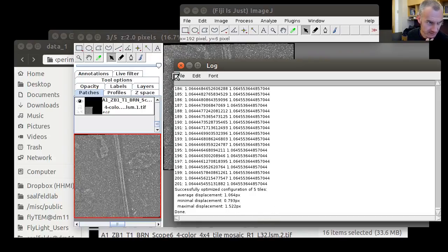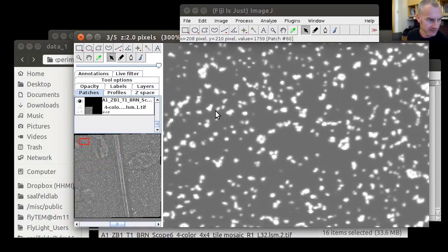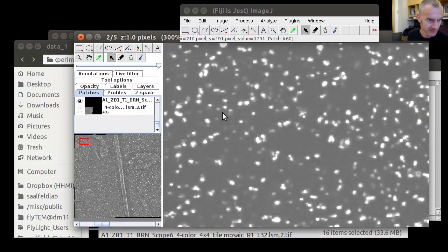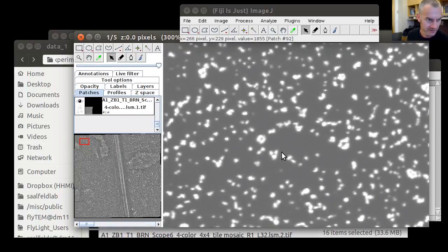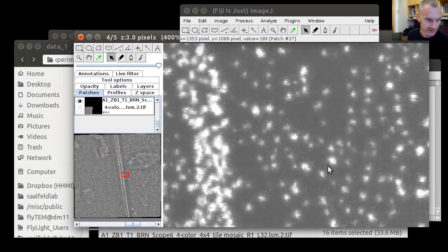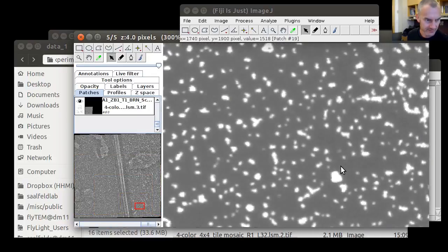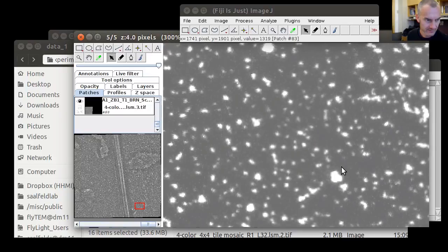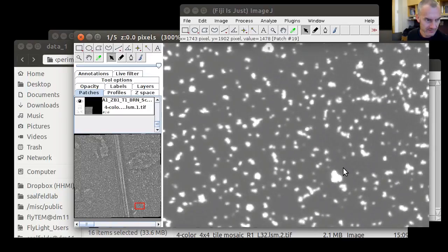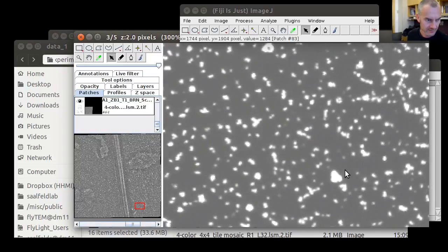Oh, so to me it seems that in the previous run we had included a couple of features that were actually not in the pool of good matches, and now the displacement is significantly smaller, so this alignment is what we're actually wishing for, and that is consistent over all places in the entire field of view. All right.